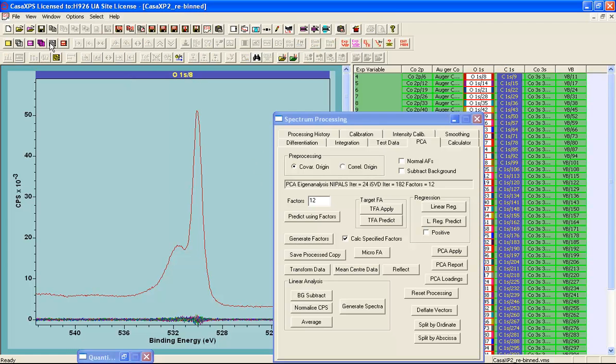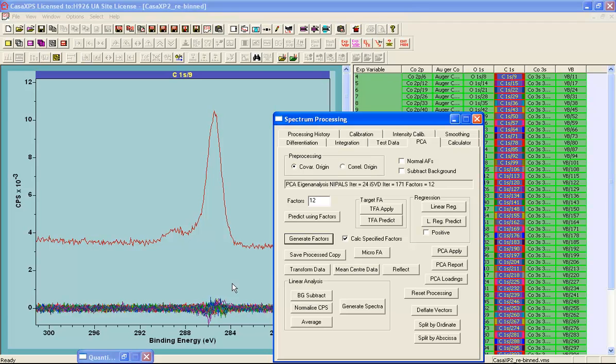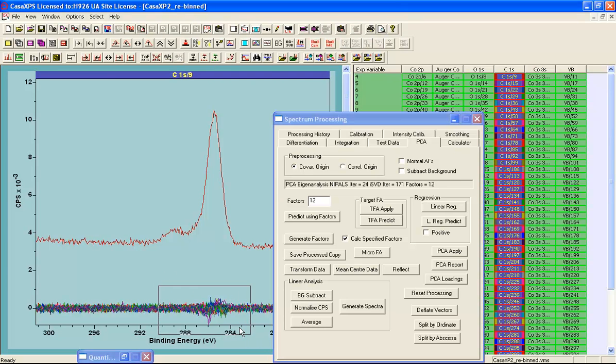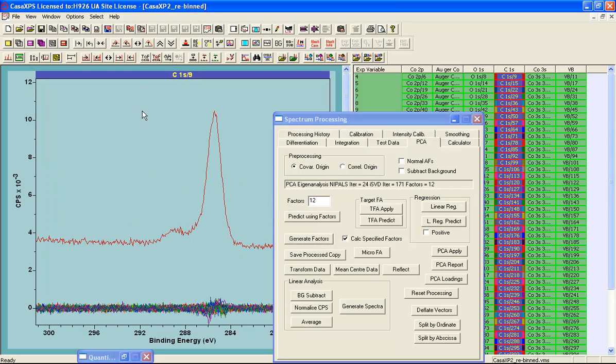So let's have another example. This is the carbon. And again, we can generate the abstract factors. And again, for the most part, the higher abstract factors just look like noise. So the only abstract factor of significance is the one that would be the same shape as the spectrum that we'd calculate by summing all of these data.